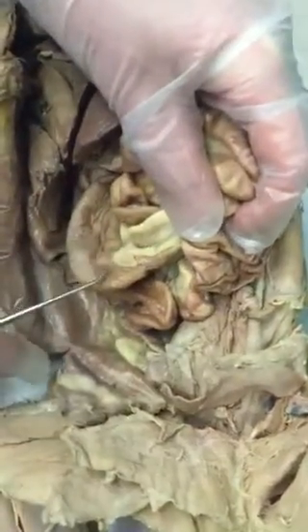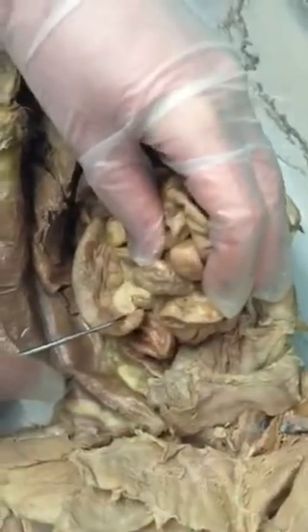Is that where the duodenum is also? The duodenum is the first part of the small intestine. No, you don't have to know the region. Okay, so just remind me where the small intestine versus large intestine is.